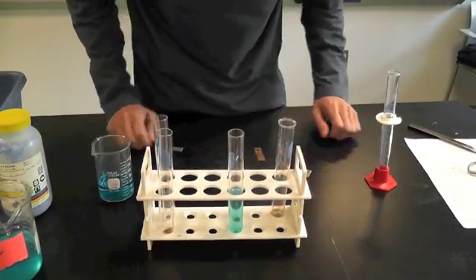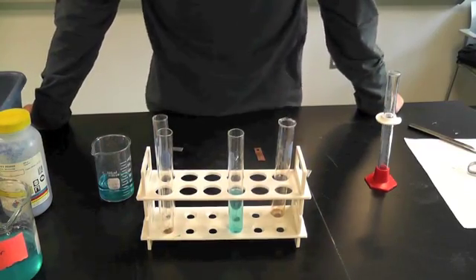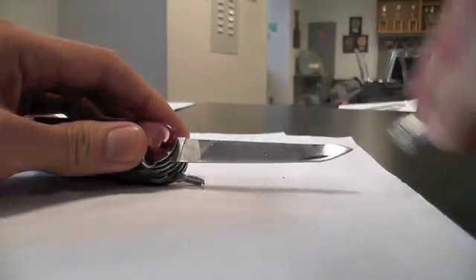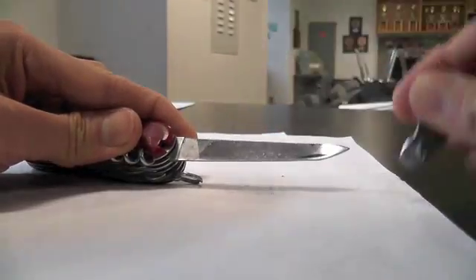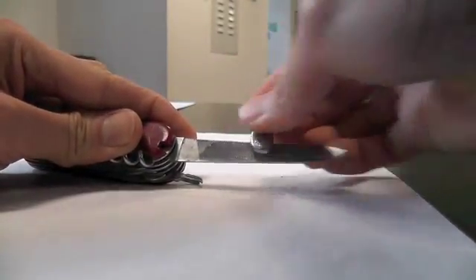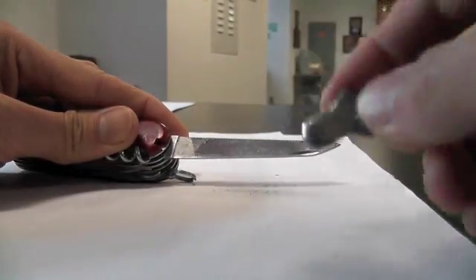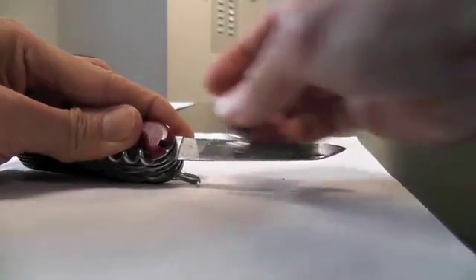And we have some metals here. First, we're going to look at the reaction of lead in the copper nitrate solution. One thing I always like to do and recommend is take the metal that you have and file it down or scuff it up a little bit because you want to get that oxidation off. You don't want any of that compound of oxide, in this case lead oxide. You don't want that on top. You want the pure metal underneath.